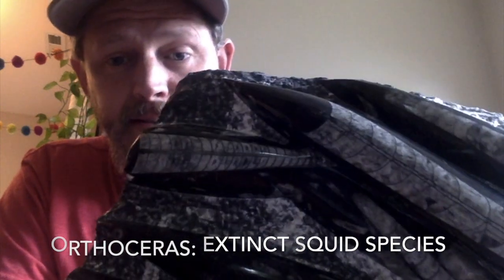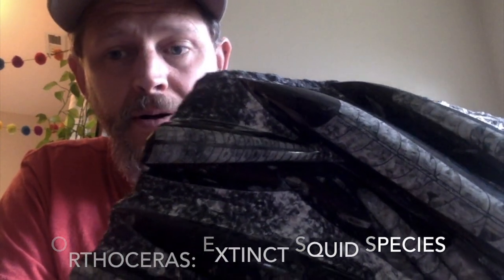So these squid from millions of years ago had shells. The squid that we just dissected had a pen, which we were able to pull out of their mantle that provides some structure, but is certainly no external shell.